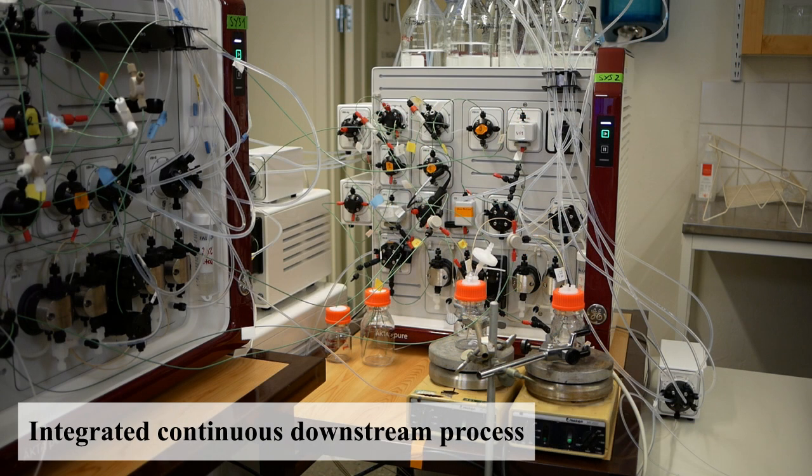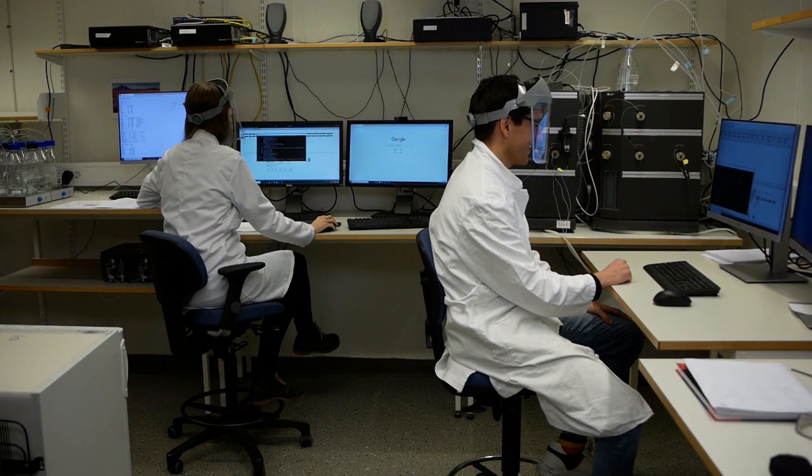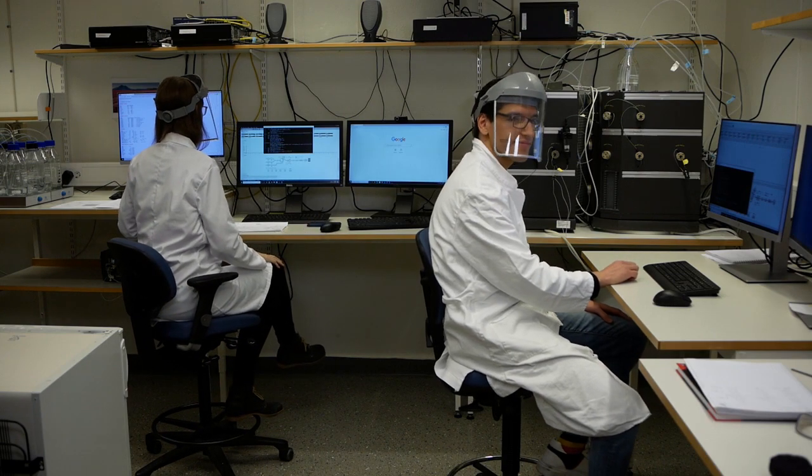The setup includes 2 chromatography systems performing the purification steps. The process, which is fully integrated and automated, and requires minimal operator intervention, is started via the computers controlling the chromatography equipment.